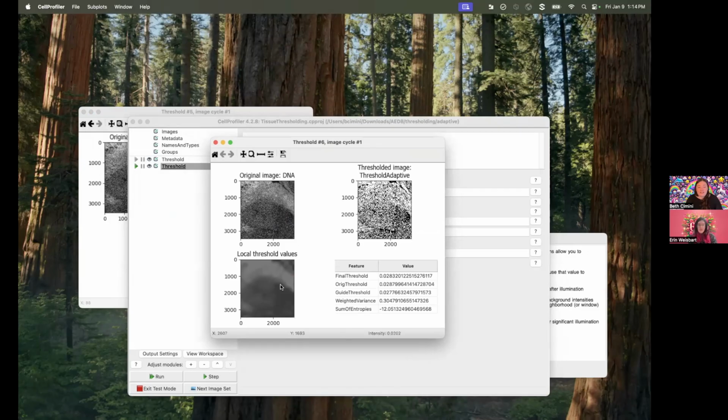But you can see here what the threshold values are that it's picking. And I love that this is part of the module display. What you can immediately get the sense of visually is you have higher threshold values that have to be passed up here where the things are bright, and the lowest threshold values down here where the things are dim. So down here, it's picking a threshold of something like 0.02, and up here, a threshold of something like 0.04.